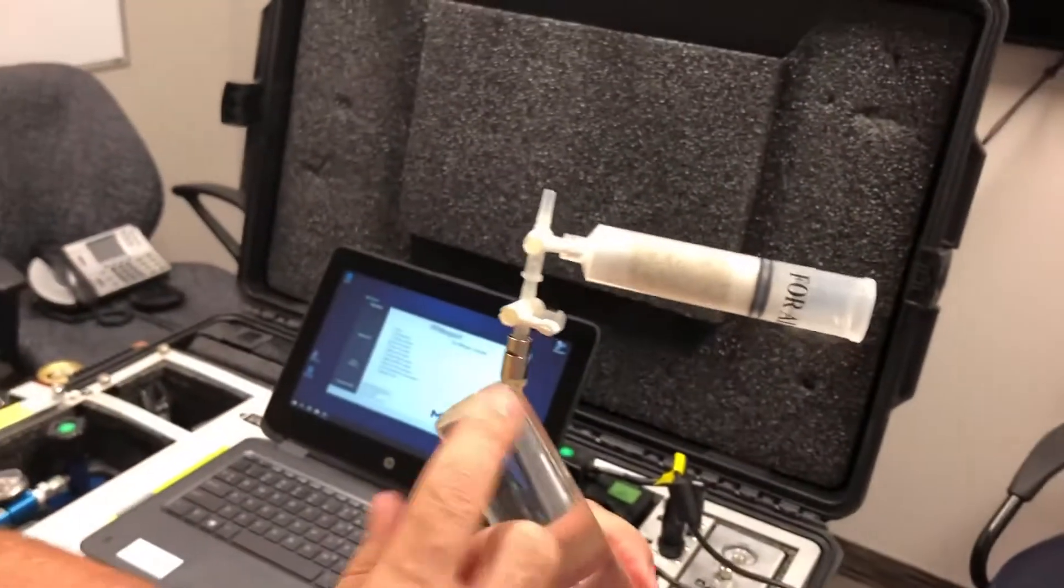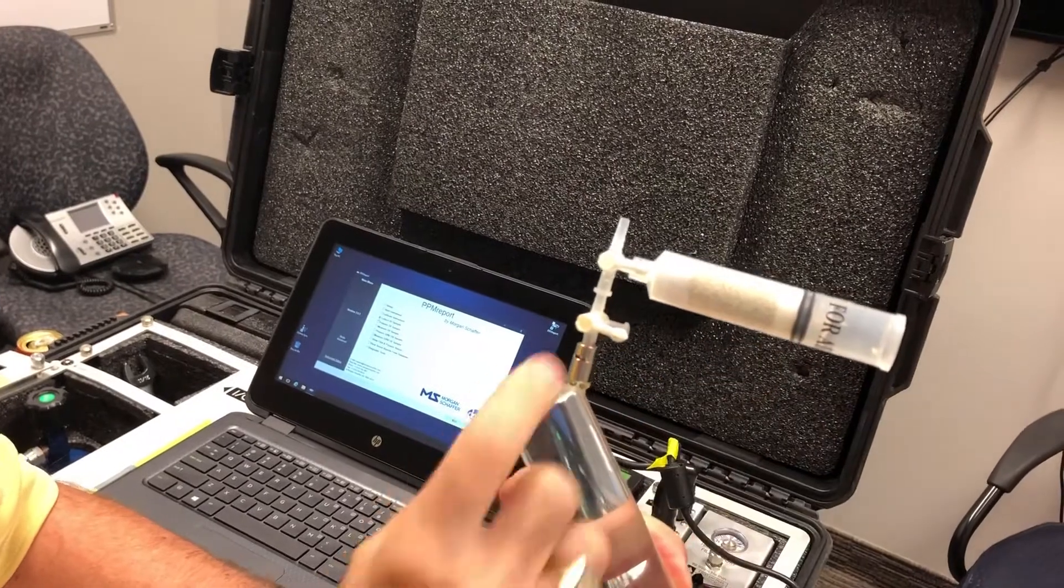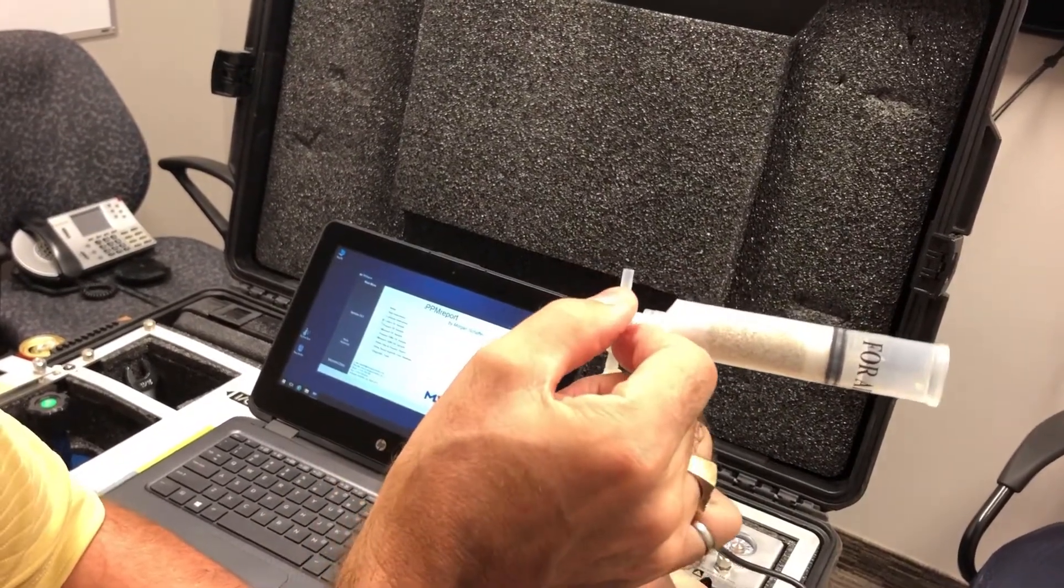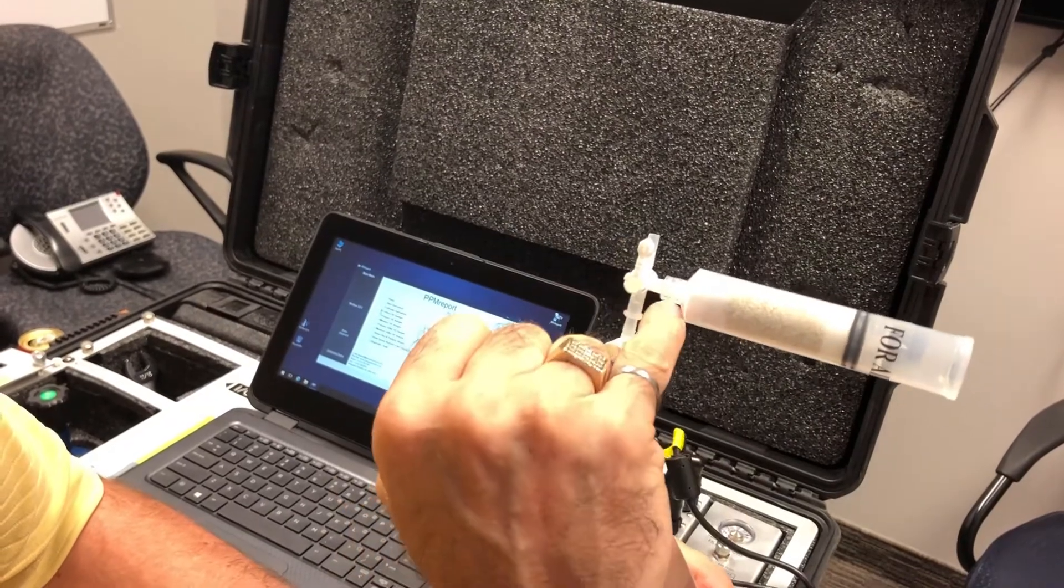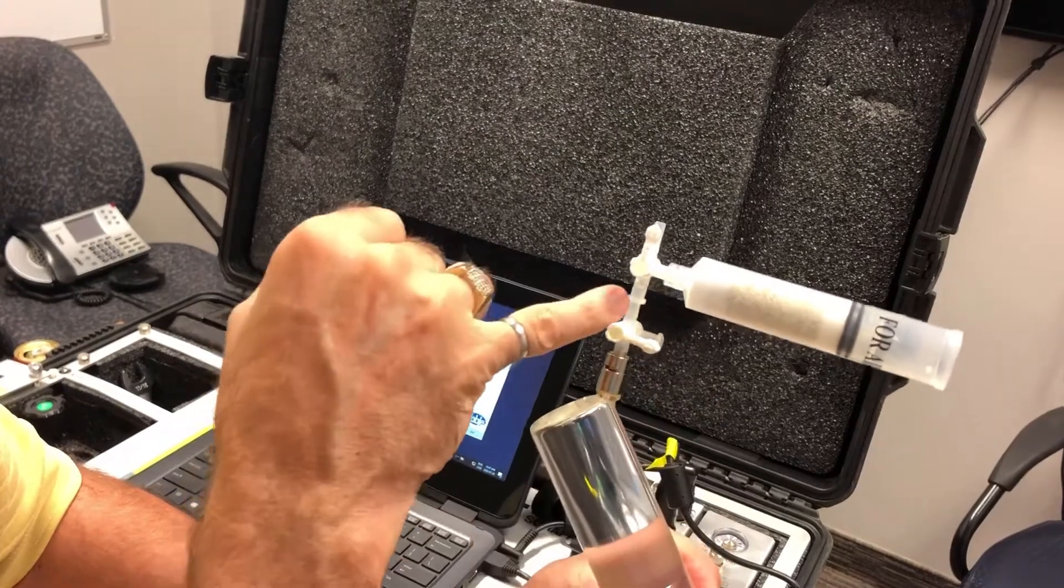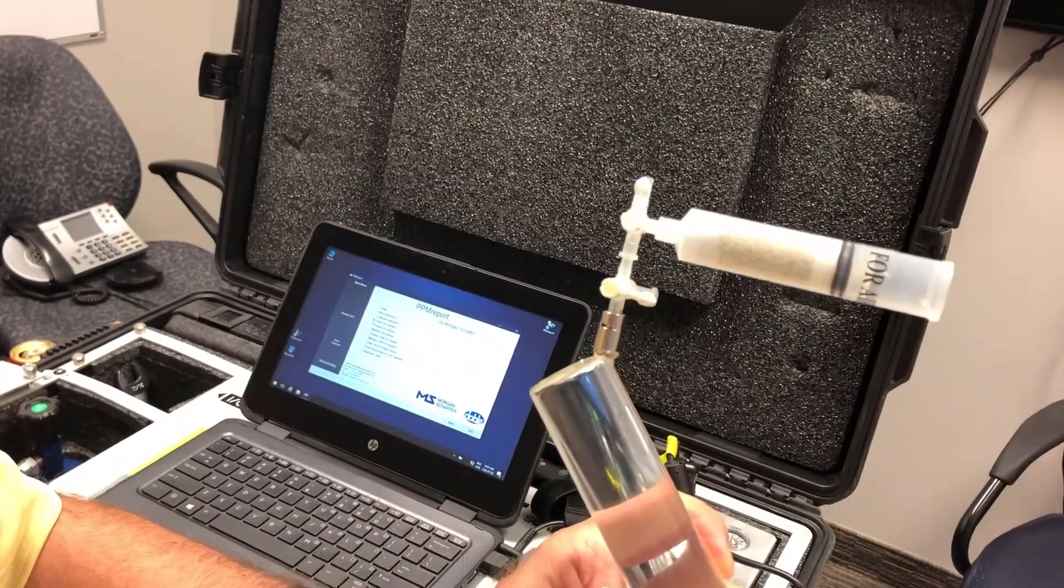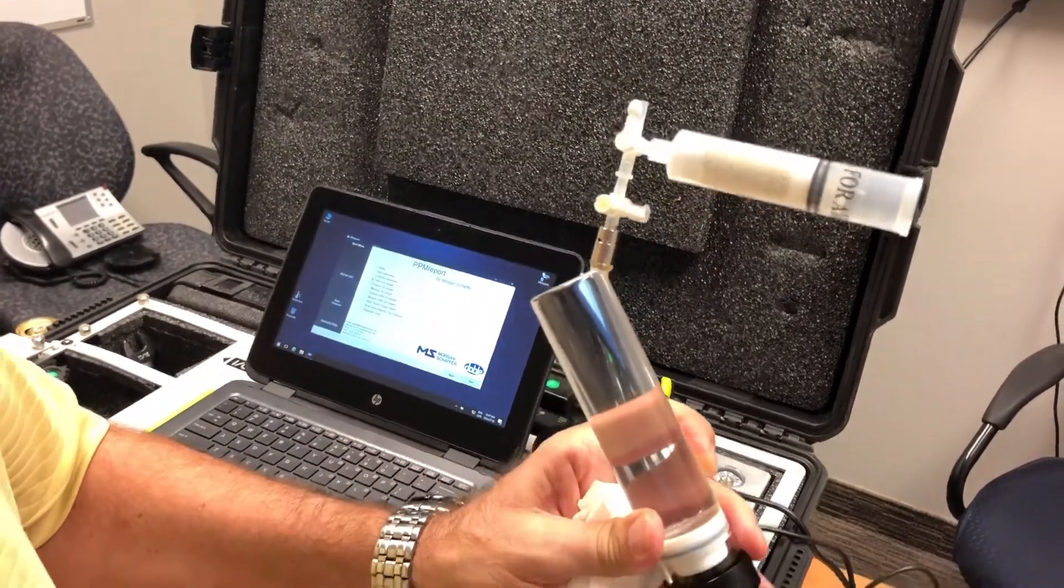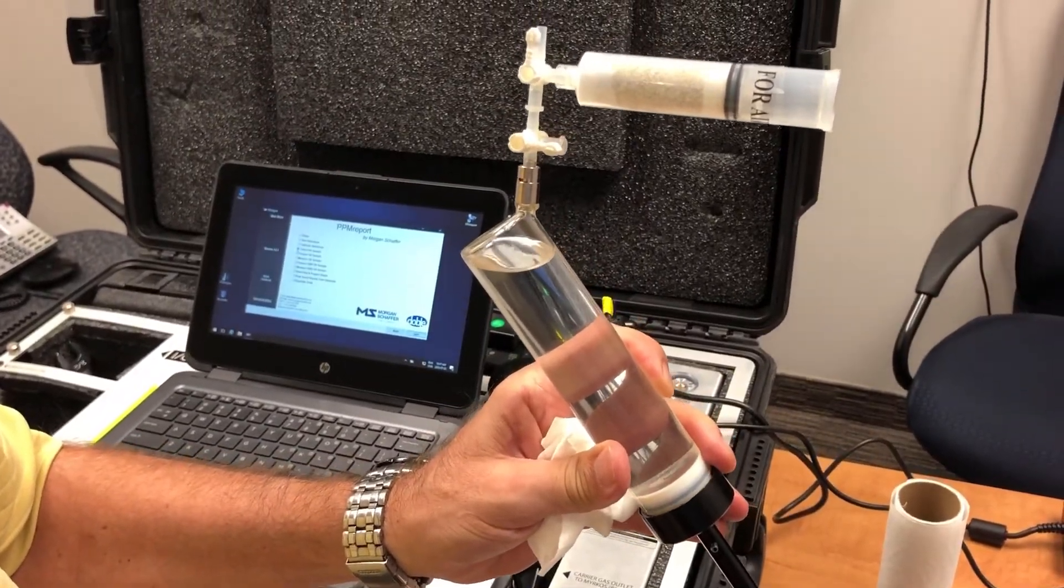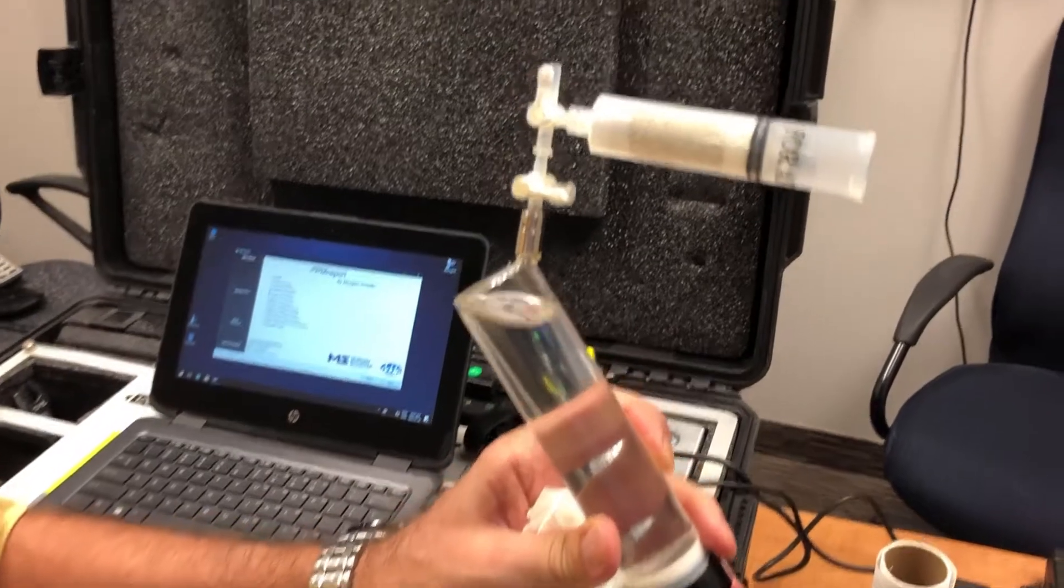So what you do is you line up the syringe. And again, now you have a three-way valve. So you put this one here. So this now, this is open, this is open. This here, close this valve. So this one is open and this one is open. So this is the way you do it. And what you do is that slowly you get air in and you create your headspace.